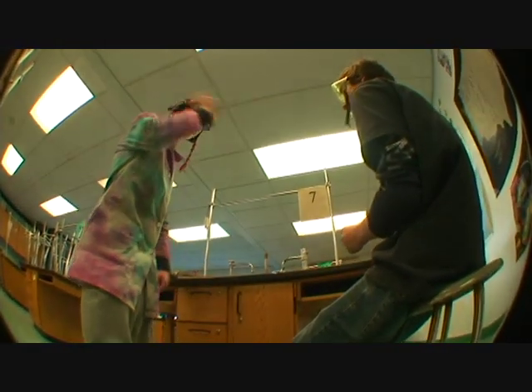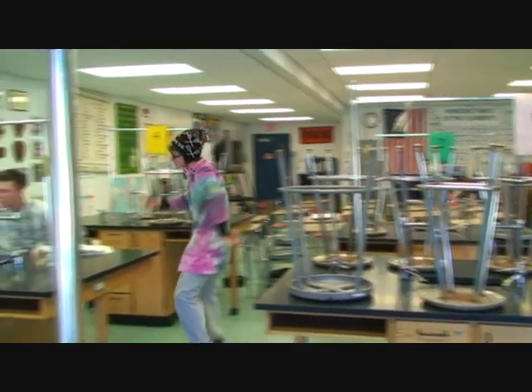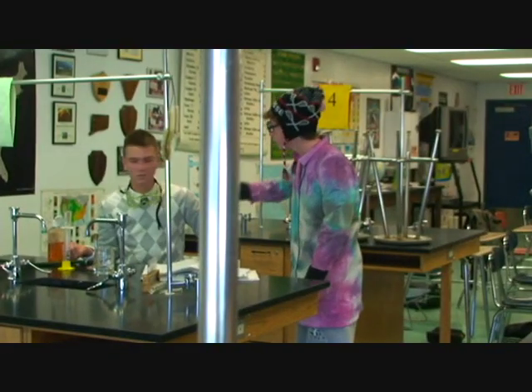Listen here, Missy. There is no eating in the lab. Okay. Listen here, Jamal. I don't care how good you are at basketball. There's no lab without your goggles on.